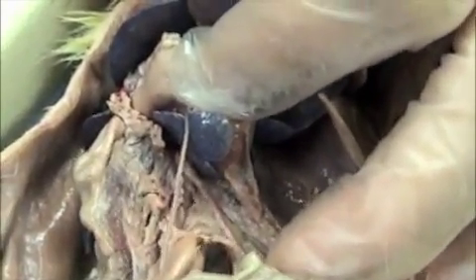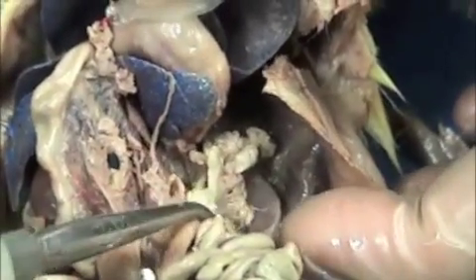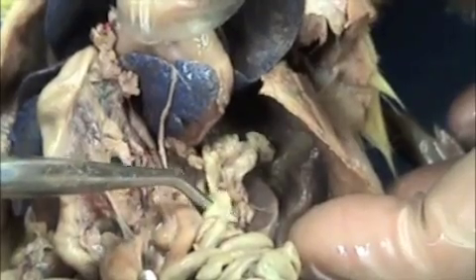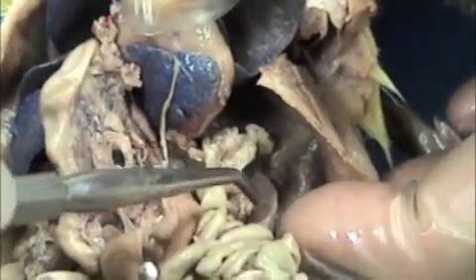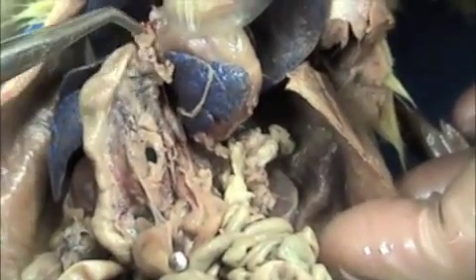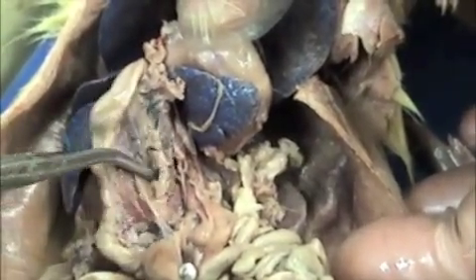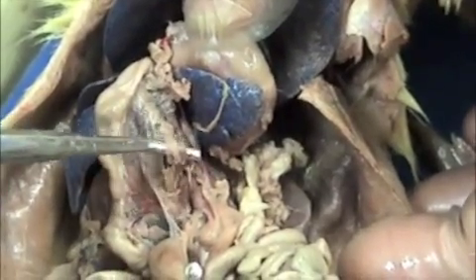Let me look and see how much of the pancreas we can see. You see quite a bit of it. Here's the spleen, and the pancreas is attached here — you see the lighter brown structures here. This white here is kind of a fat tissue or mesentery mixture. The pancreas is very thin and has a lot of mesentery in it — it's just a gland, so it's very tender. But it's attached way over here to your small intestine. So all of this right here would be the pancreas.